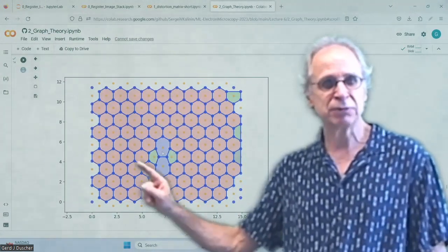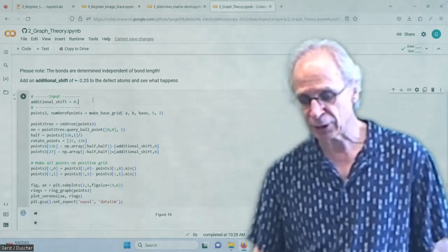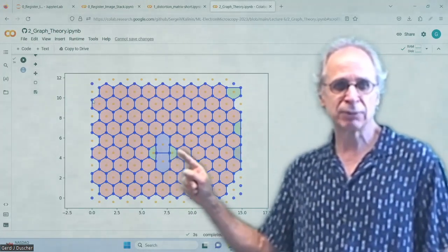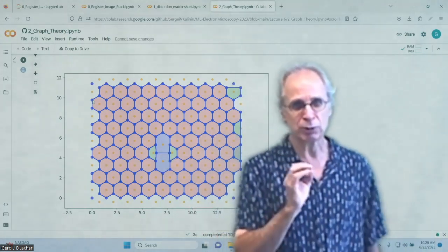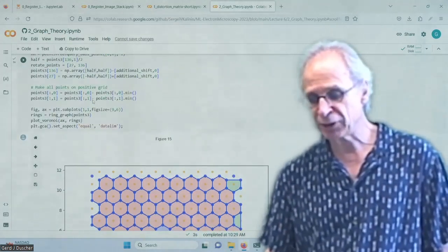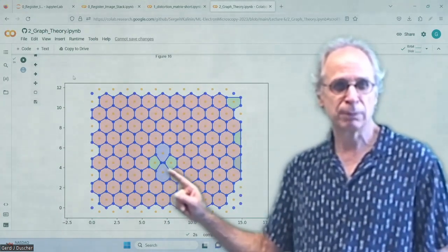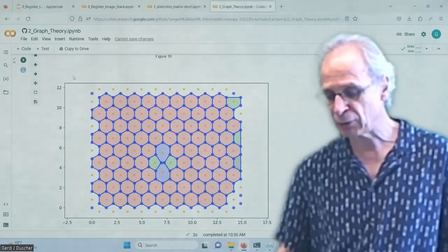And so I can play around with it now. What I'm doing is changing the positioning, the distance between those, and seeing whether it works. So if I extend it up to 0.25, you see how large this bond is, and how short this one is. So it's independent of how large that bond is, because it's only depending on the rings. Let's go in the negative, put them very close together. Okay. Yep. Nice. No problem. Always the same idea. So independent of distortion, you can shear it, of course, or whatever.